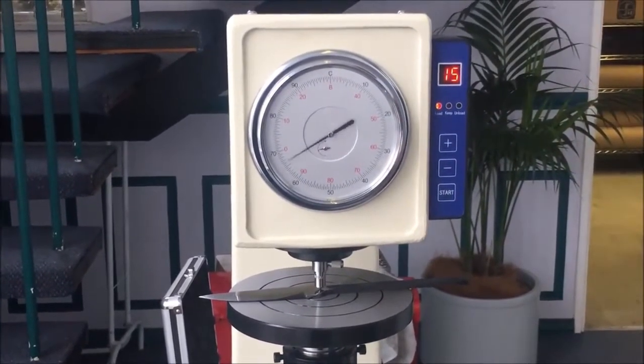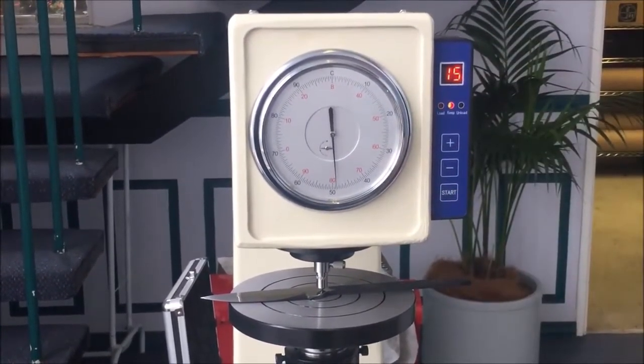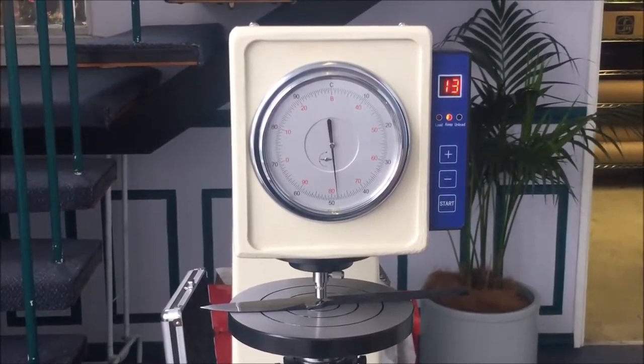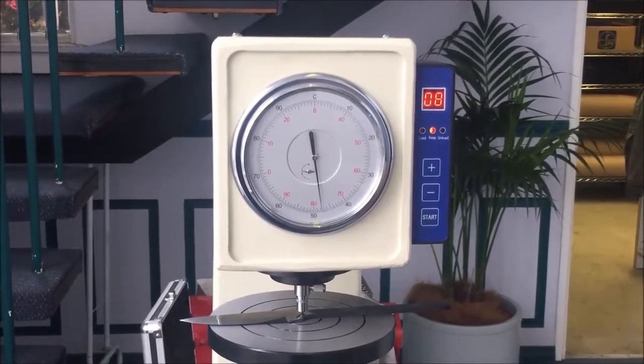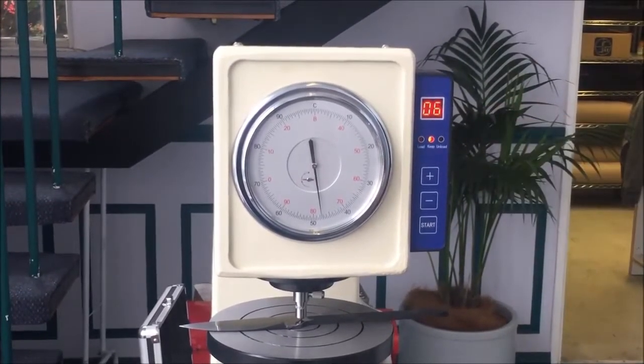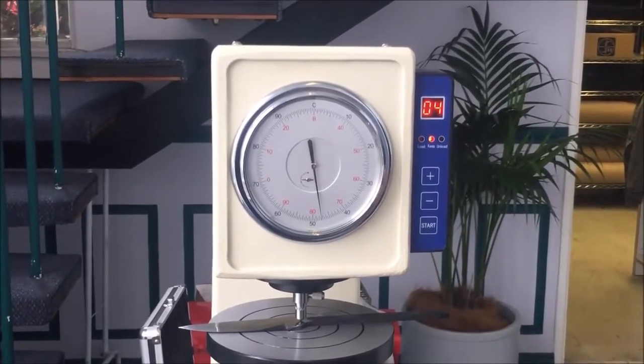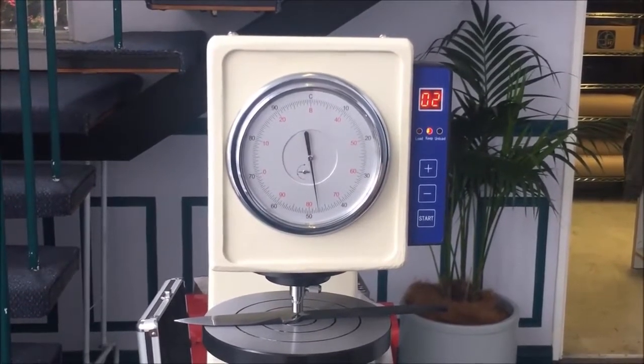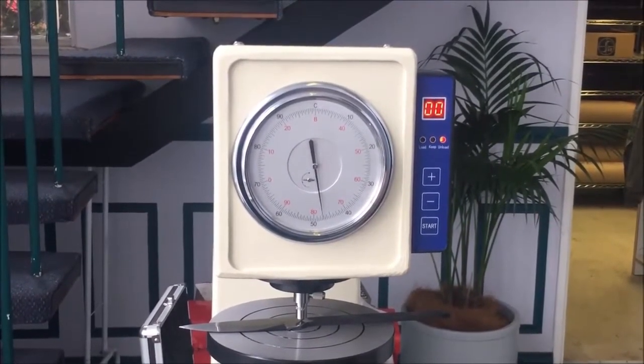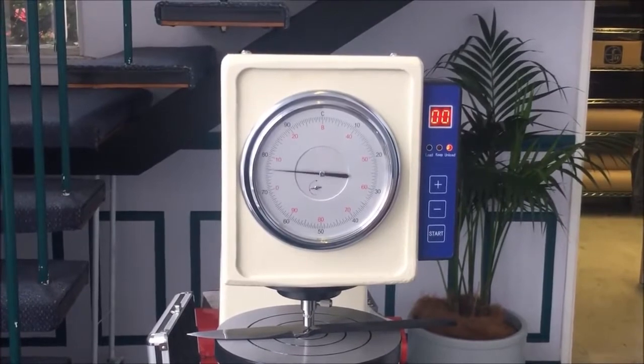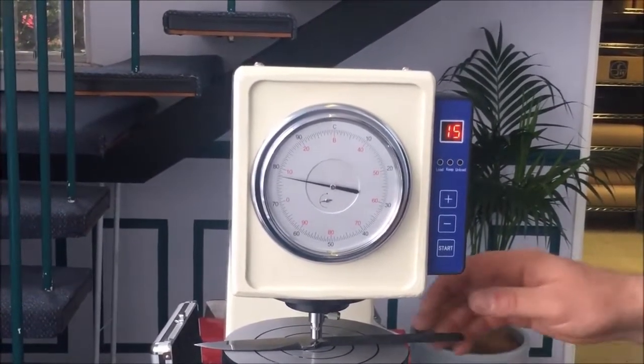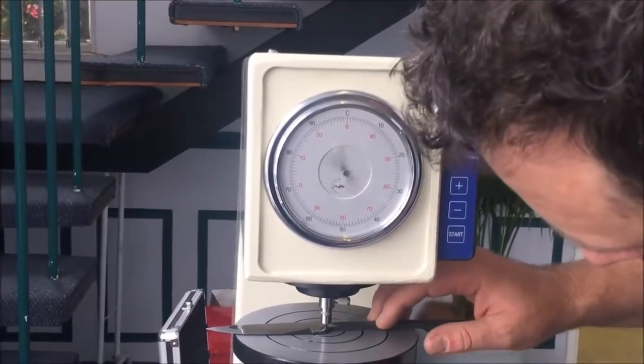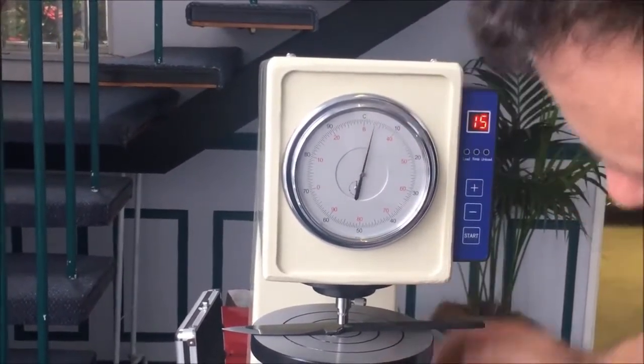Press start. Now the machine will very carefully and gently apply the load. It'll hold the load for the number of seconds, and then it'll unload. And again, this is about extruding out all of the excess oil, so it doesn't really matter at this point what the reading comes back with.